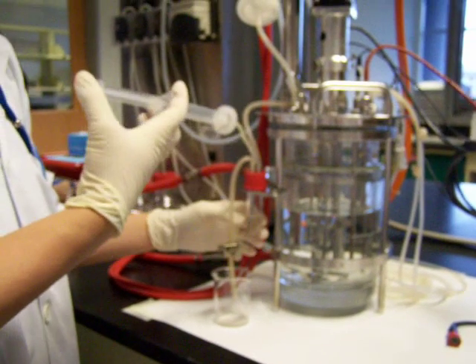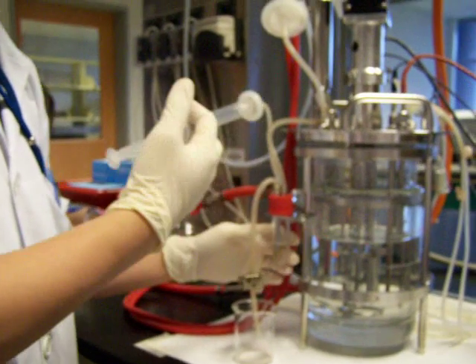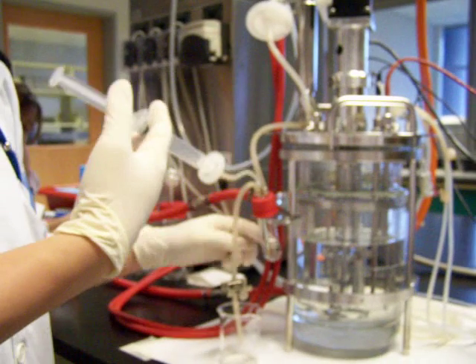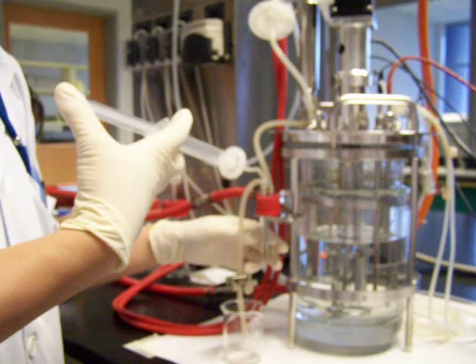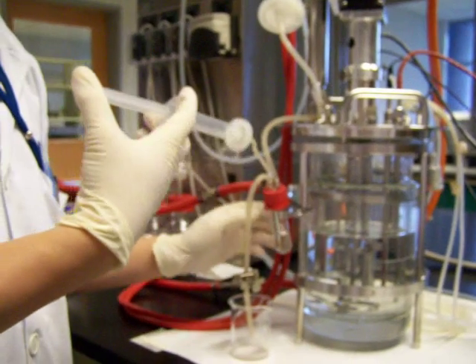It will be around, because this is a demo syringe, there's still a lot of space here. Normally you will get around five to seven mils, which is more than enough.